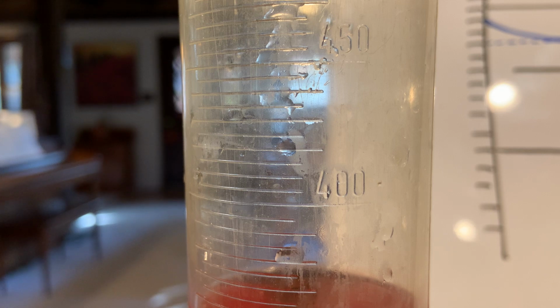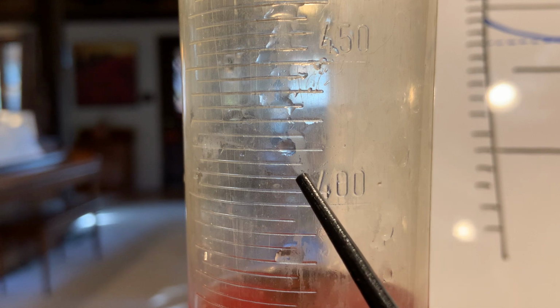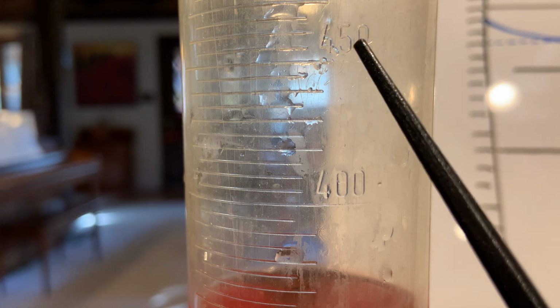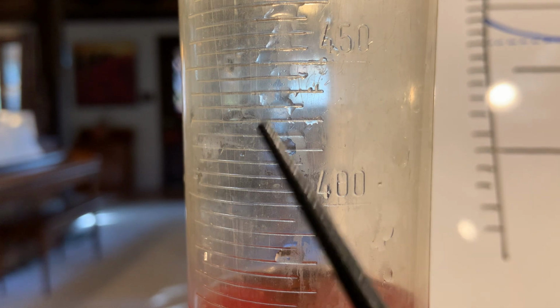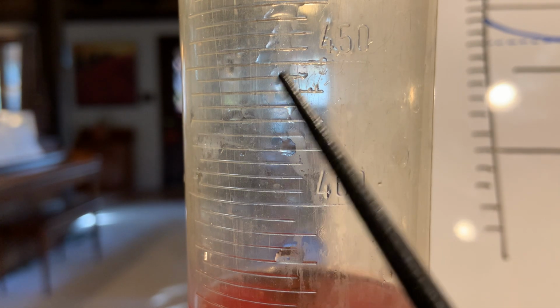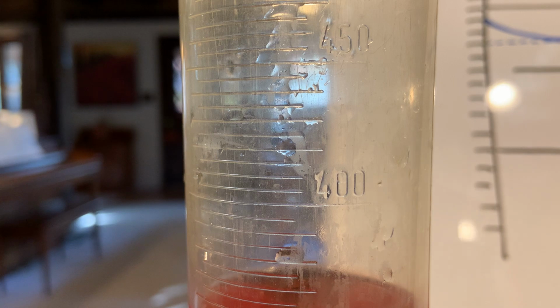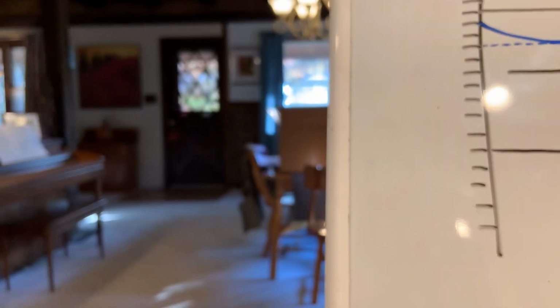If you thought it was 10, just try it out before you actually measure anything. So you would know that if this was 400, this might be 410, 20, 30, 40, 50, and that wouldn't work because 450 is supposed to be up here. So sometimes it's a little trial and error, but as you count the lines, just divide, and then you can figure out what each line is graduated to. That's why they call it graduated. Let's take a look at another one here. So this is the 500 milliliter.